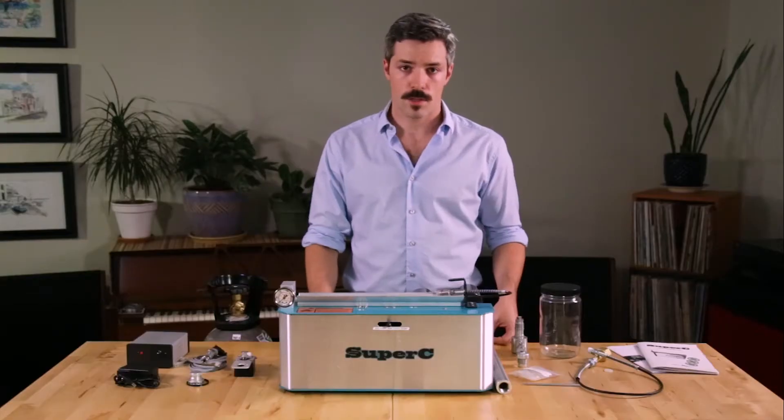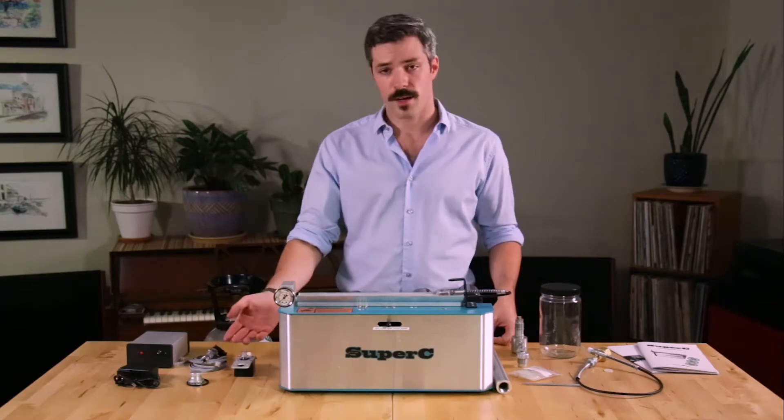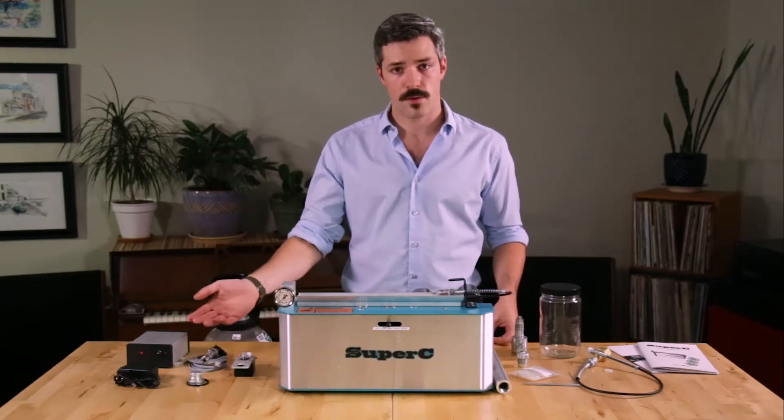As you work through the provided o-rings, it's important to make sure you keep spares on hand, so when you run low please be sure to order replacements from our store. Your system will also include the autopilot pressure regulator. It's comprised of five parts and I'll show you how to mount those next.